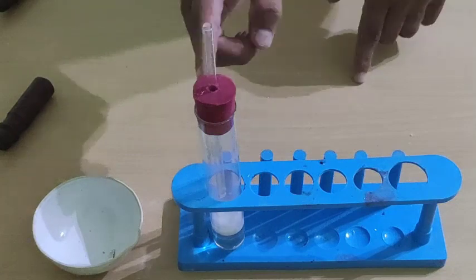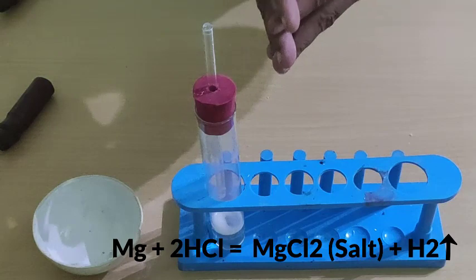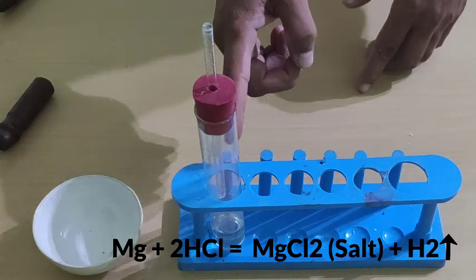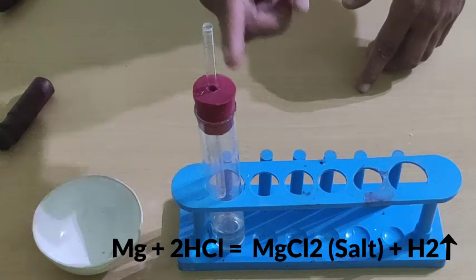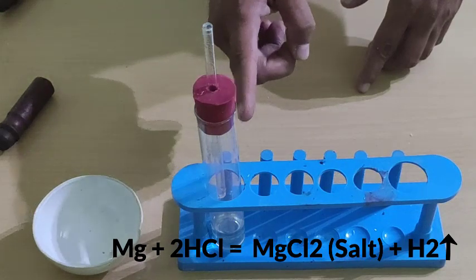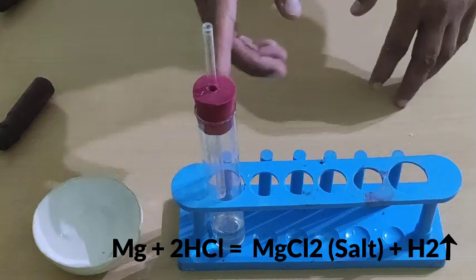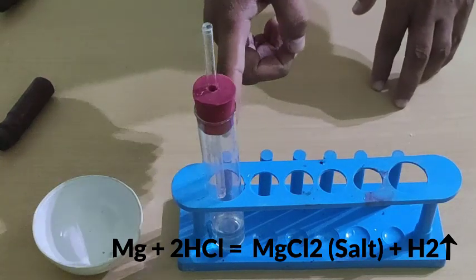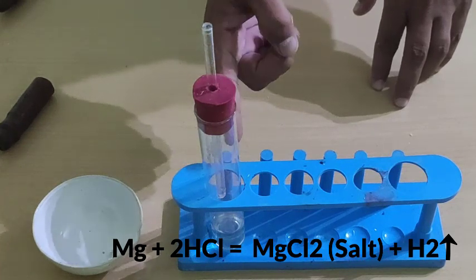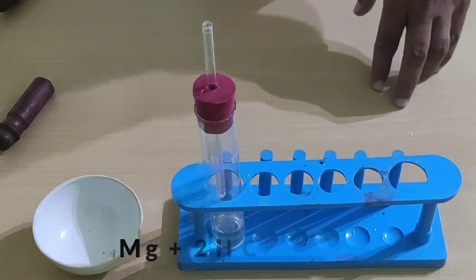The metal magnesium and dilute hydrochloric acid reacted. The magnesium displaced hydrogen from HCl and it was released through this gas tube. And what remained in the test tube? When magnesium converted into a basic radical, it reacted with the acidic radical of the acid, and magnesium chloride salt remained in the test tube, and inflammable hydrogen gas was released through this gas tube.